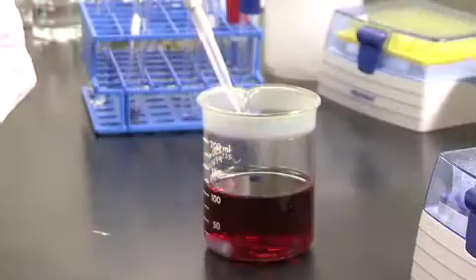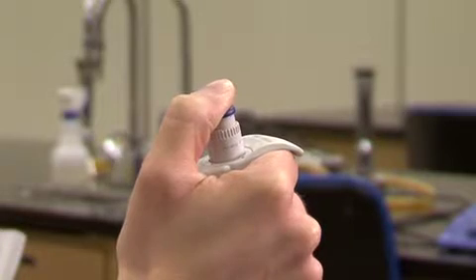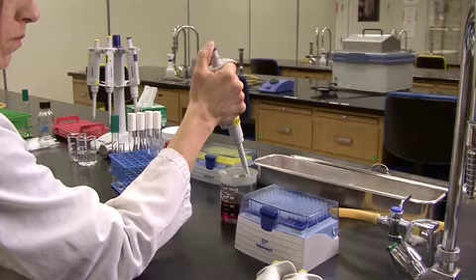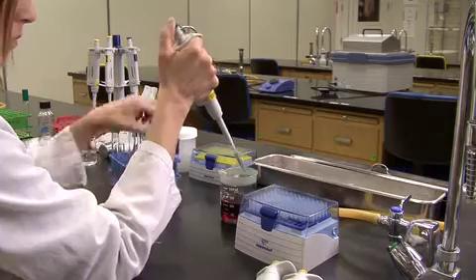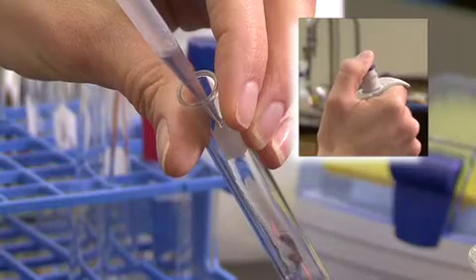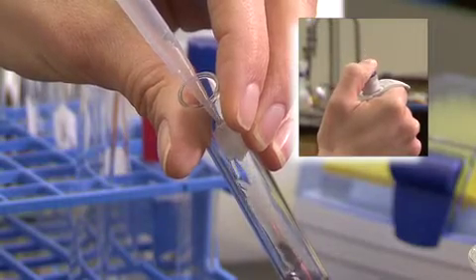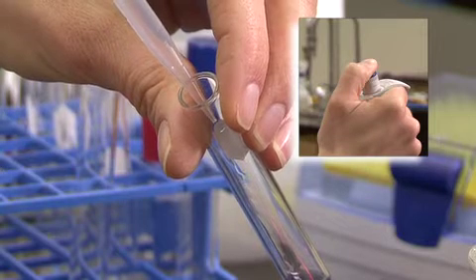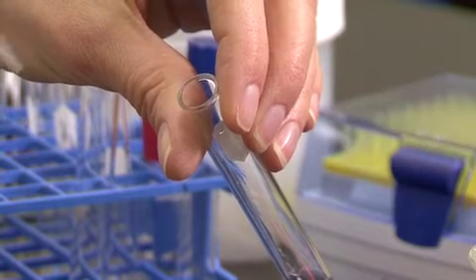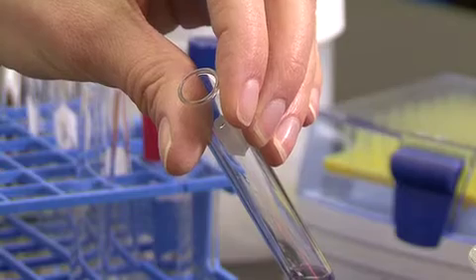Once the tip has been placed into the liquid, the plunger is slowly raised and the liquid is drawn into the tip. When dispensing the liquid, you will push the plunger down to the first stop, then through the first stop to the second stop to blow out any residual liquid. There should be no liquid left in the tip if you have done this properly.